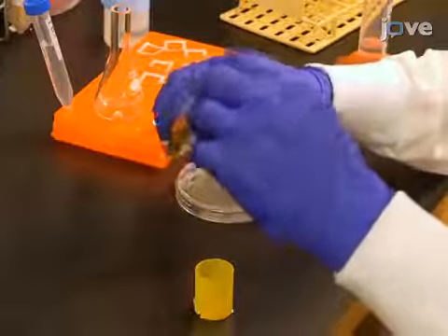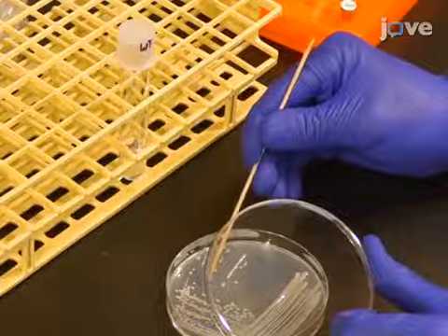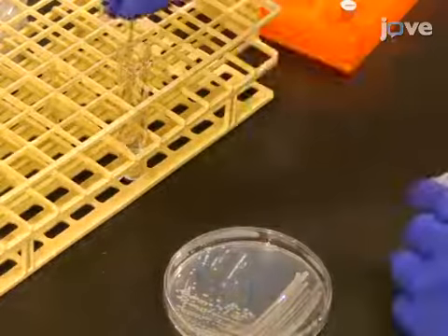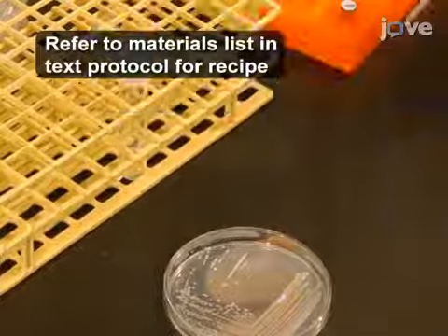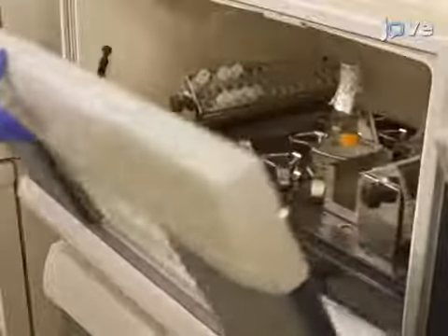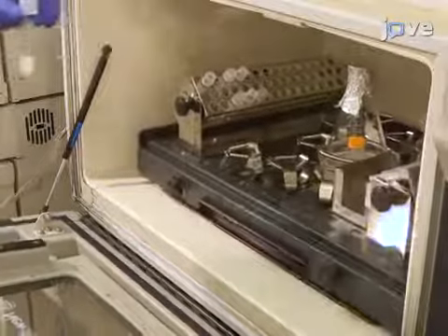To begin, use a sterile wooden stick or pipette tip to inoculate 3 milliliters of ATGN growth medium with a single colony of a wild type or mutant strain of A. tumefaciens. Grow the culture at 28 degrees Celsius and 225 RPM overnight.